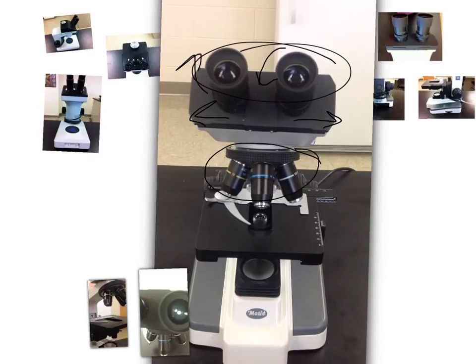Here are the oculars. Let's rotate. So you can rotate it. You're going to be putting your slide on your stage. This clip retracts so that you can slide your slide right on in. And here is your light source.